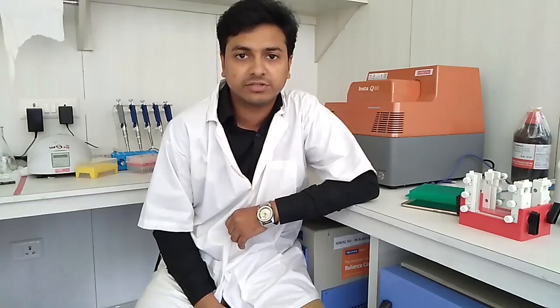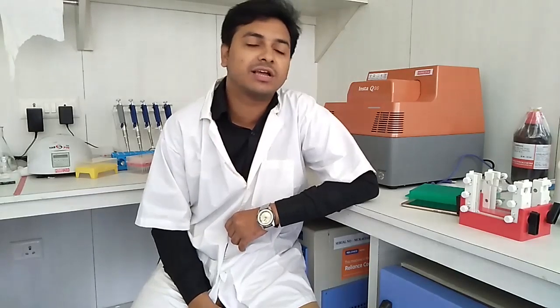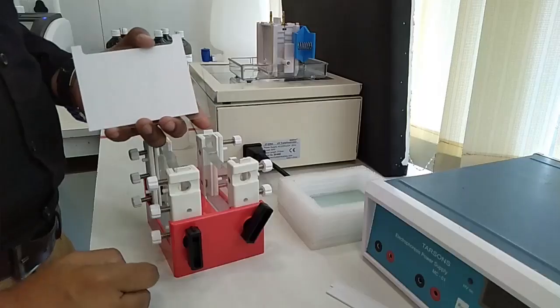Hey, this is Subham here from Personalized Medicine Institute. We generally do here two kinds of electrophoresis. One is agarose gel electrophoresis and another is polyacrylamide gel electrophoresis. Today we are going to show you how we do polyacrylamide gel electrophoresis here.